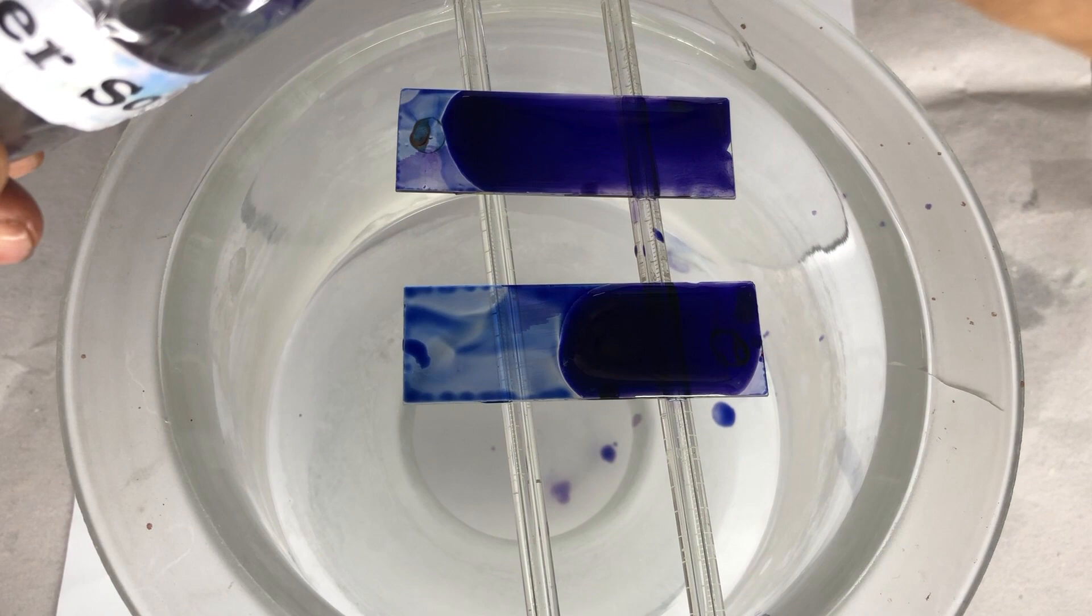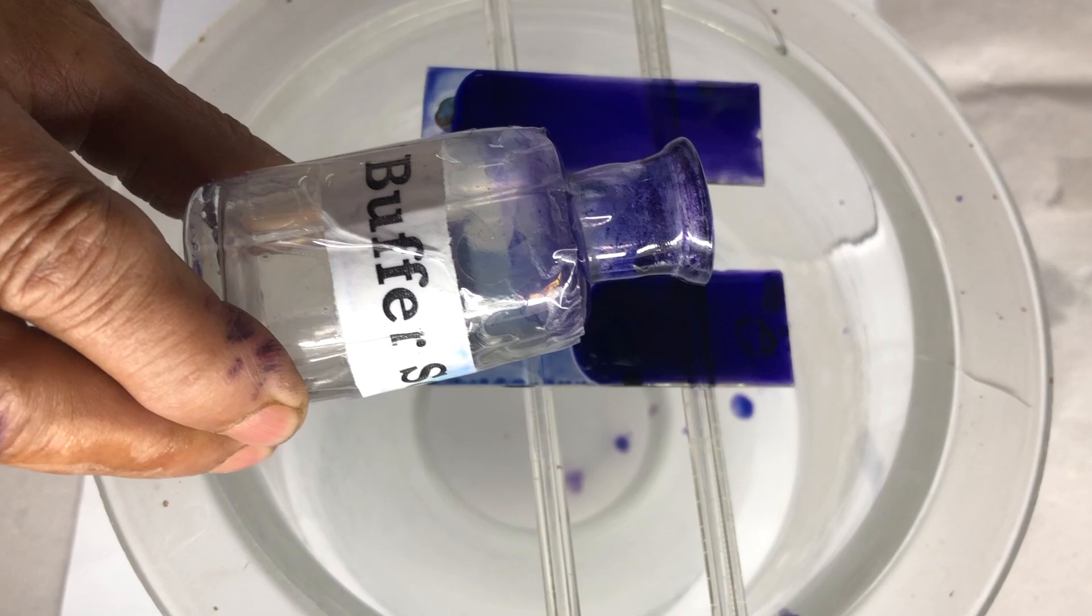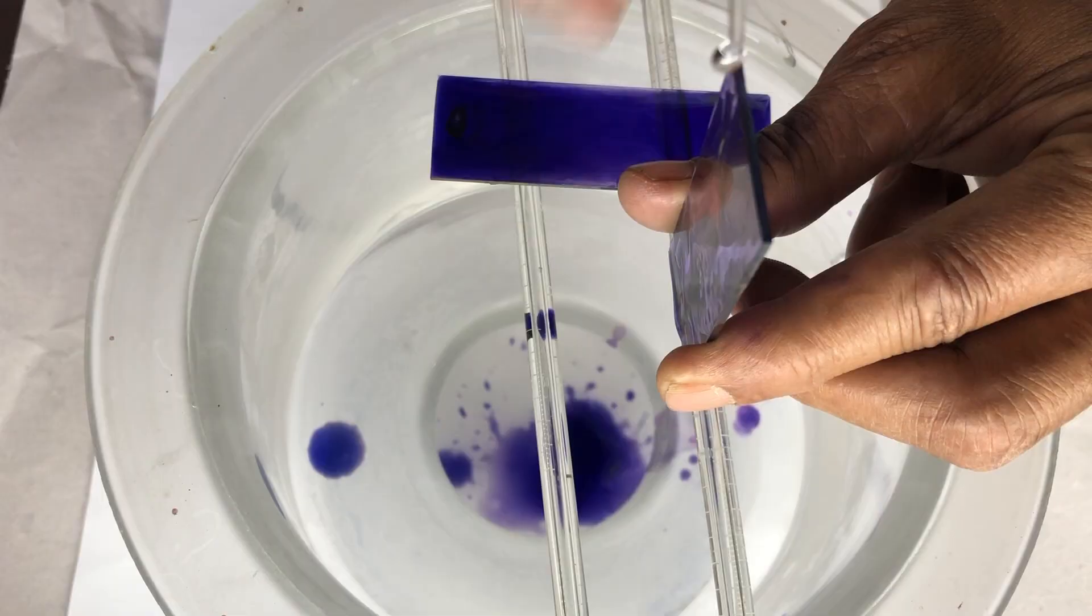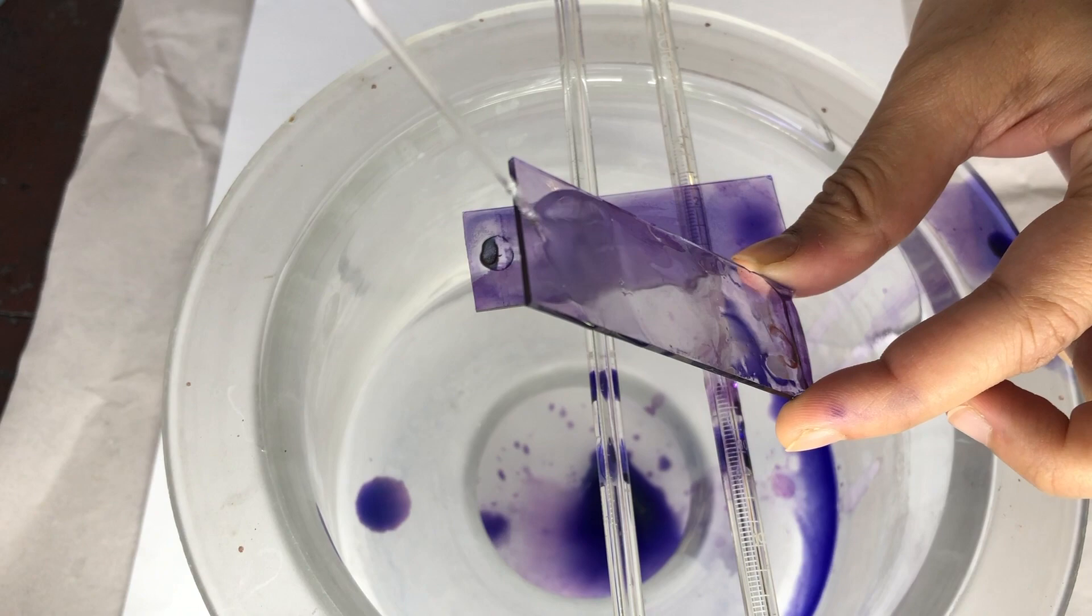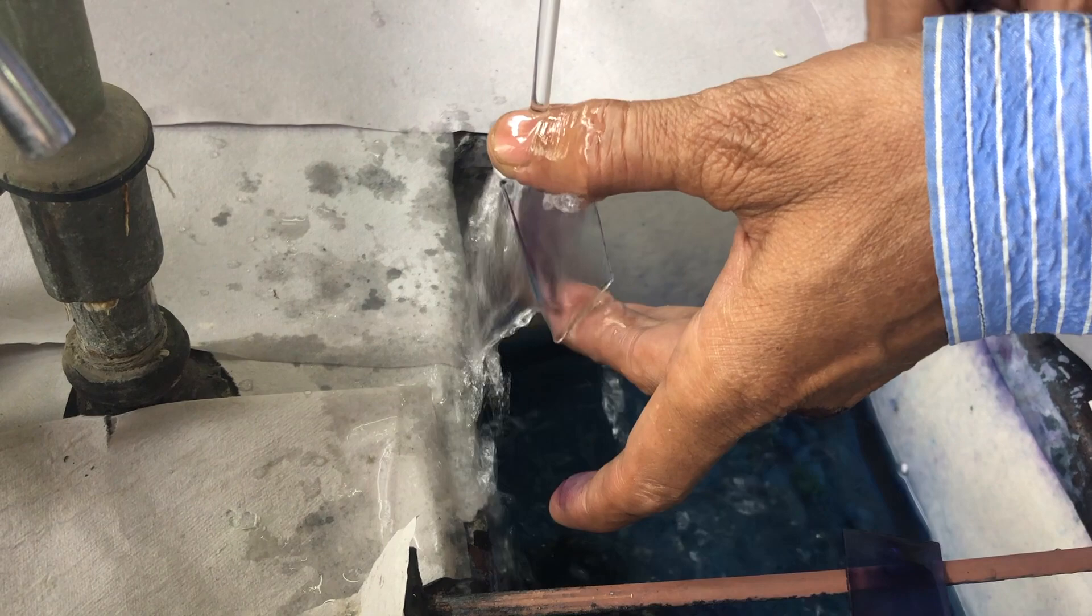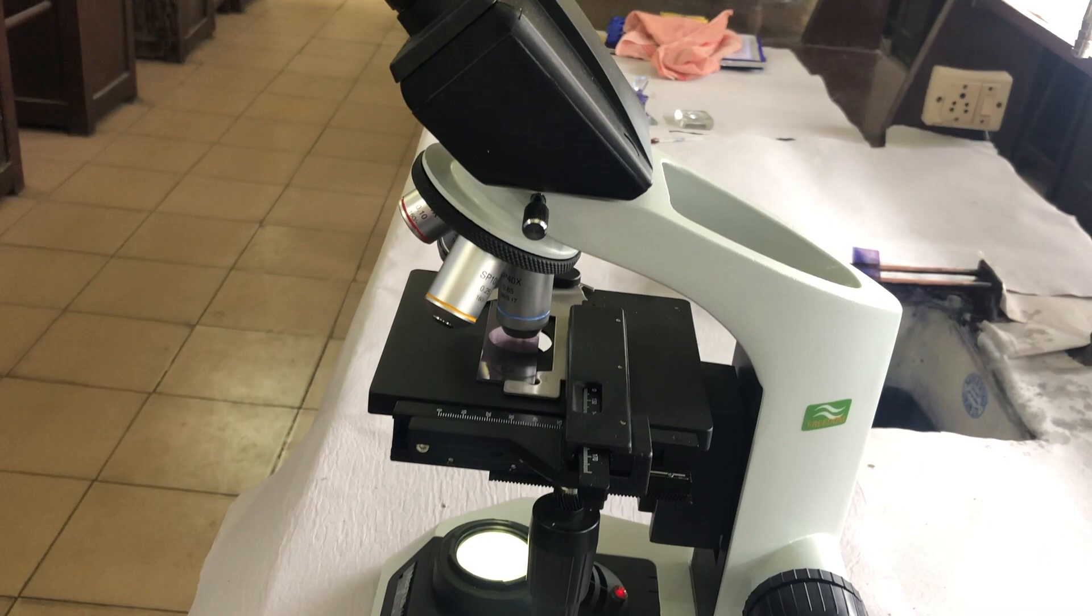Maintain enough buffer solution so that the slide does not dry up in between, and after 8 minutes we wash it under water. For washing, pour some water on this. We can even wash it under water, just ensure that the water does not run off your film.